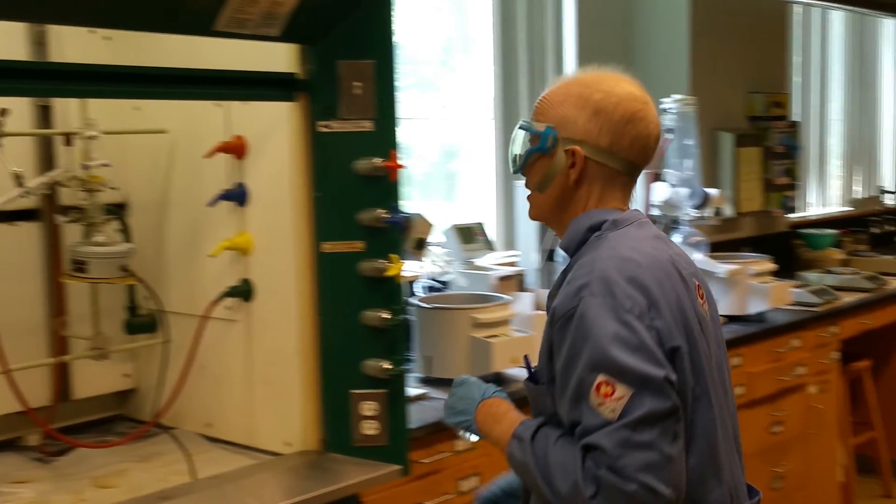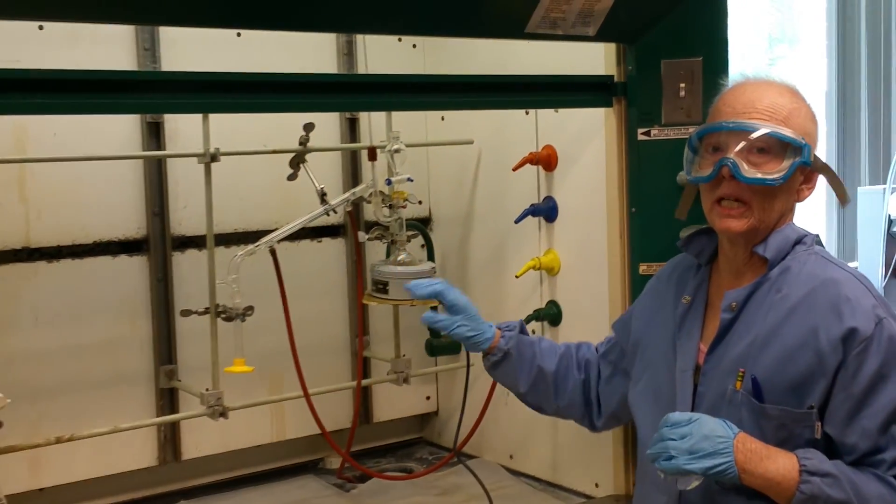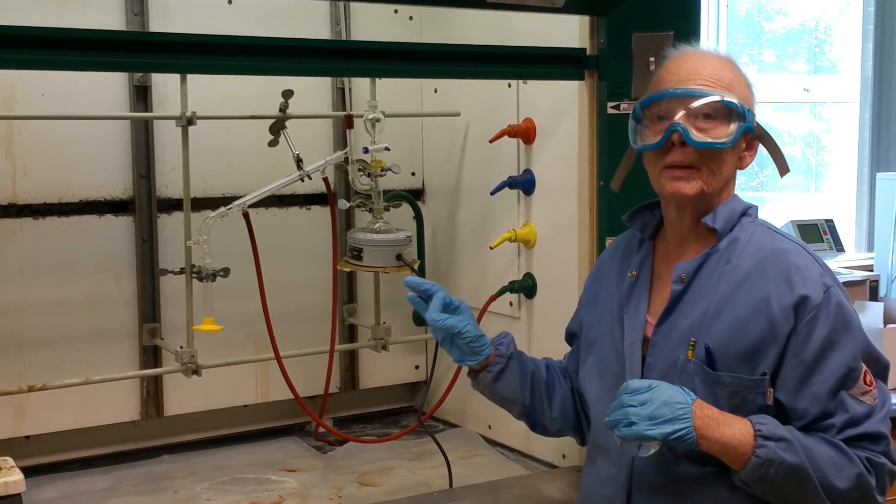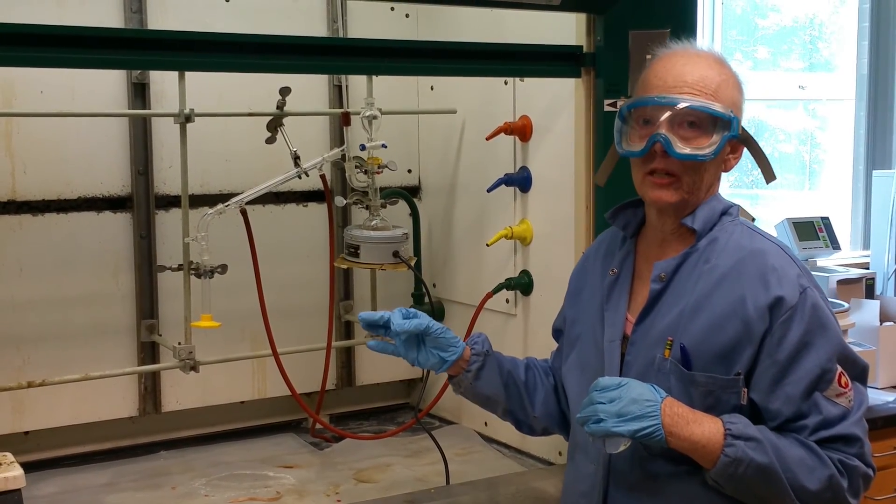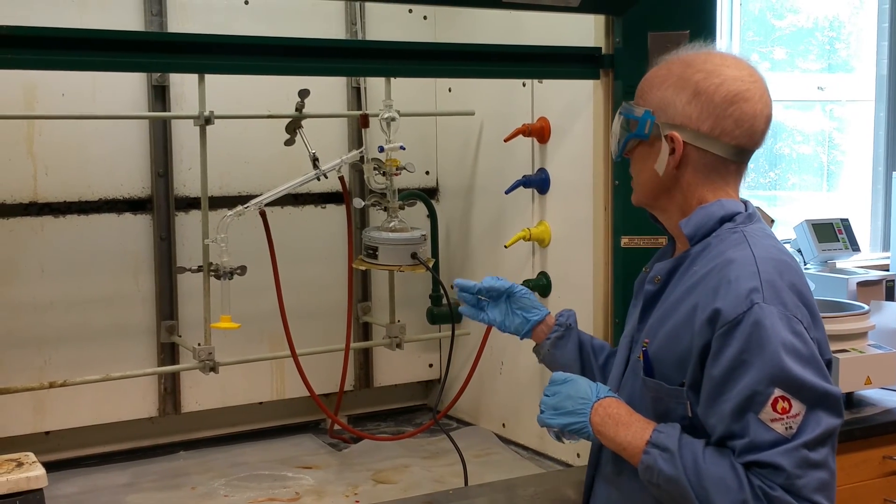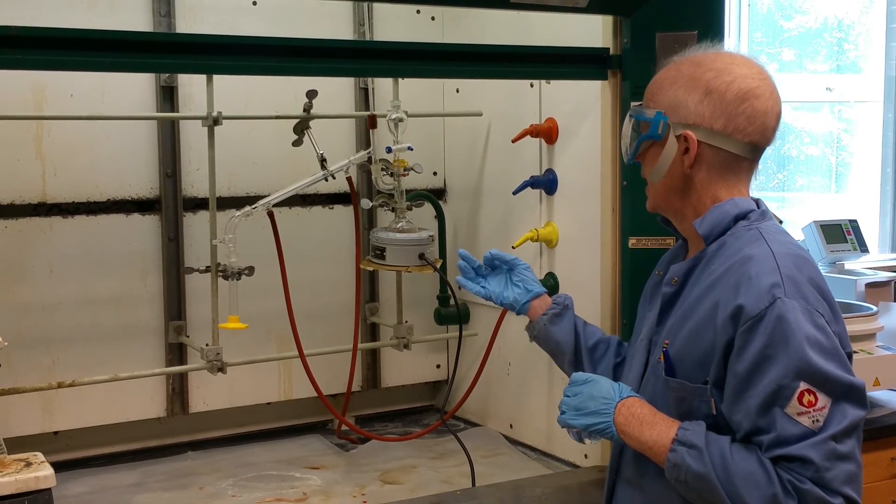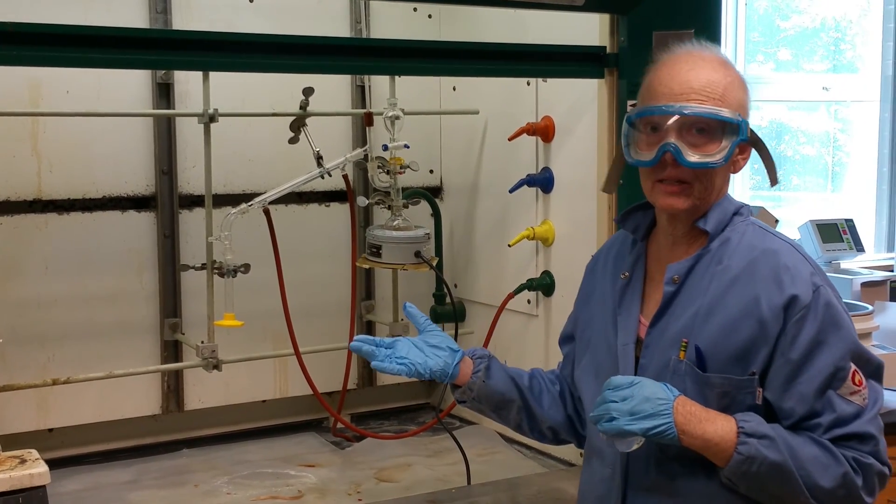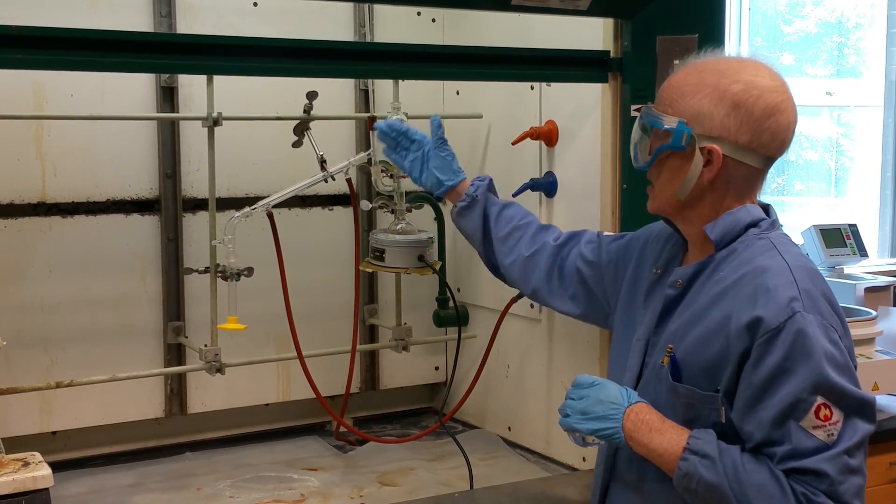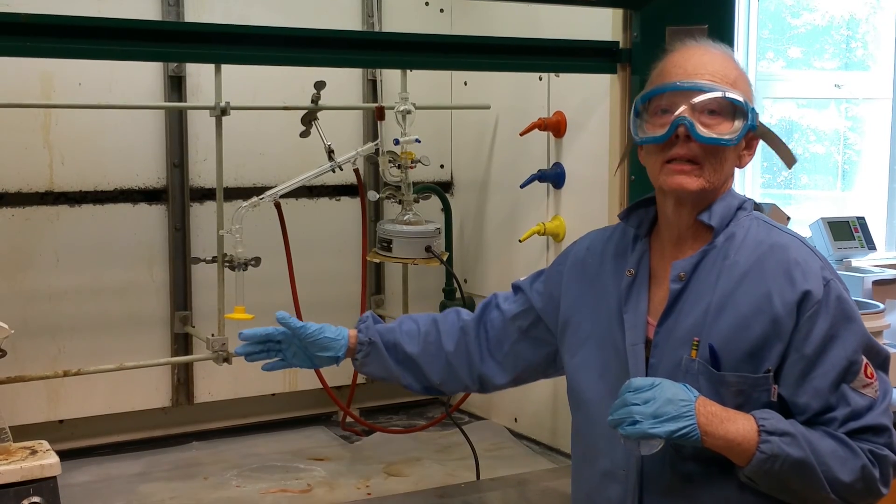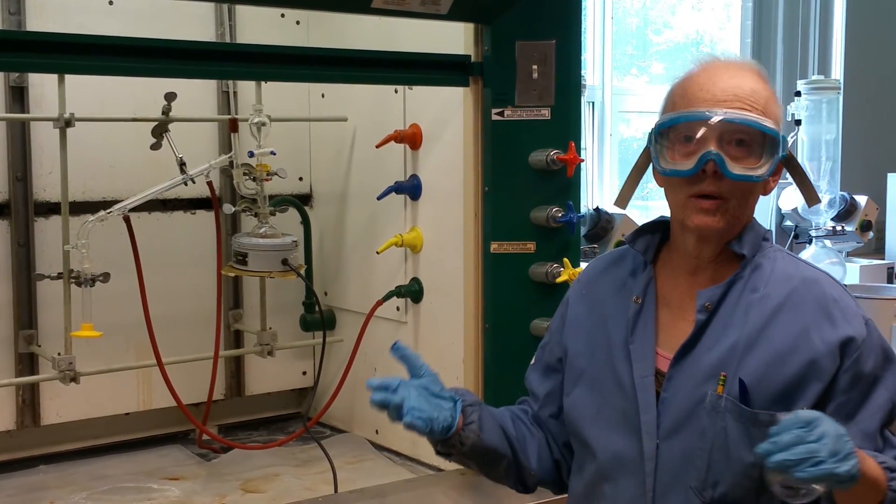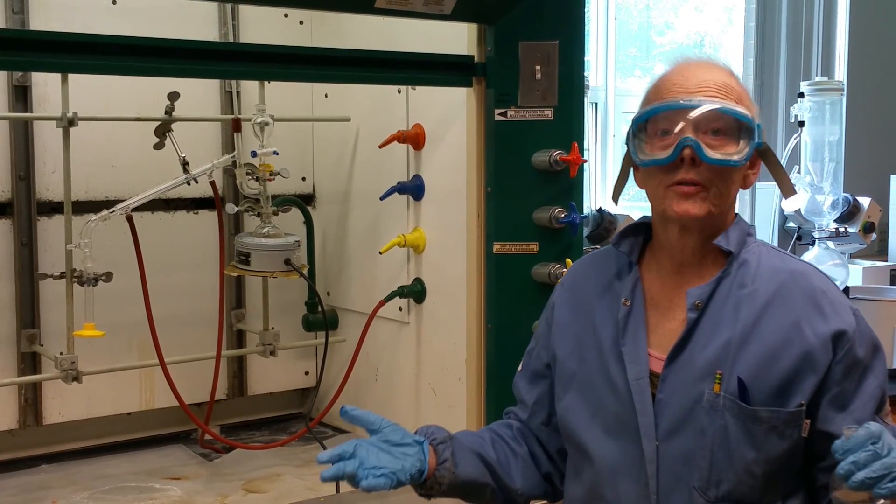We now have a different kind of rotary evaporator which I'll explain to you, and I'm going to show you how to use it. But it's valuable to look at any video, even our old video on rotary evaporation. To get started, I just want to compare rotary evaporation to distillation. In lecture and in the first weeks of lab, you will be learning about distillation.